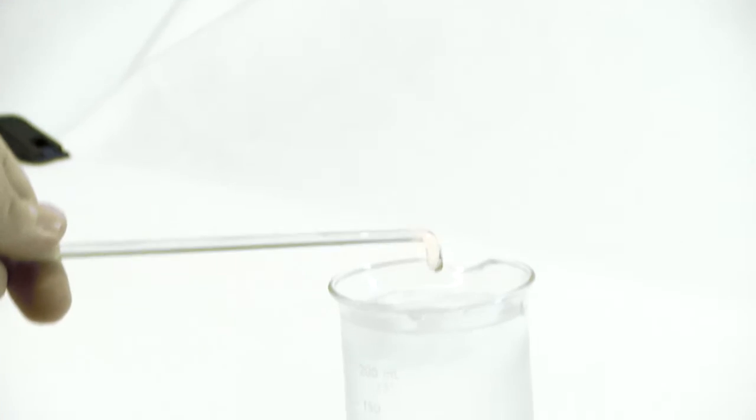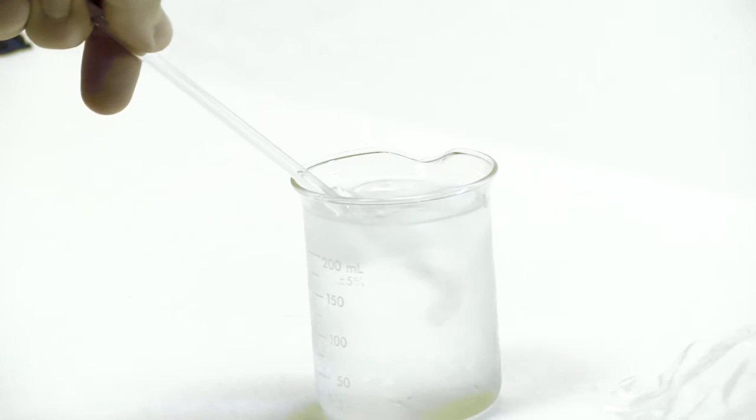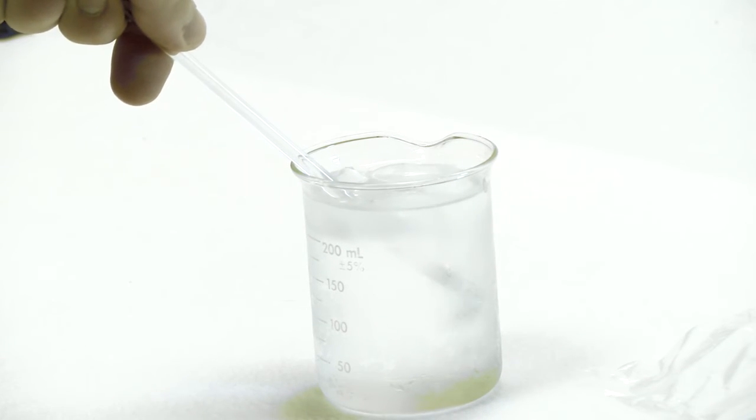Remove from the flame and quench in the ice water. Thermal shock will occur and pieces of glass will break off onto the bottom of the beaker. There will be many fractures throughout the portion that was heated.